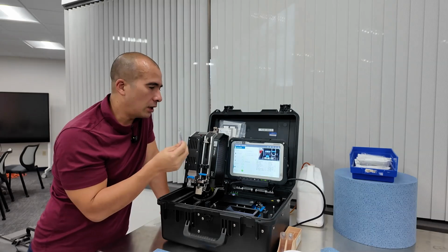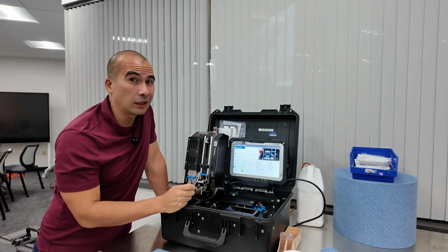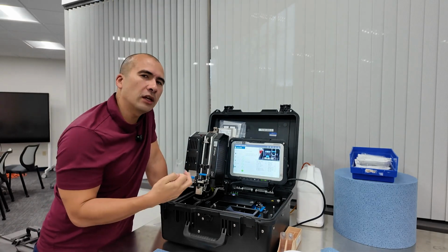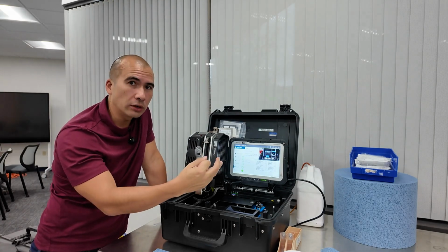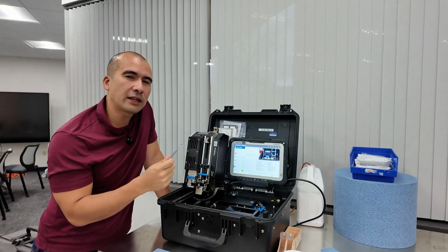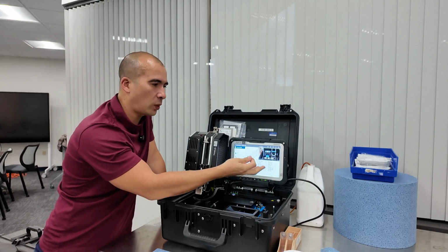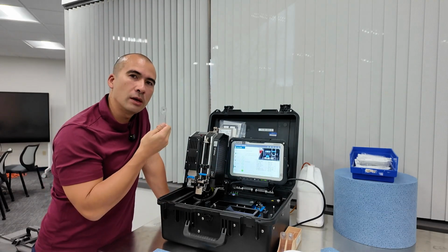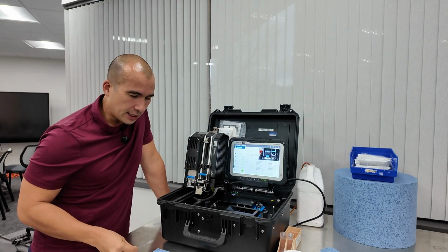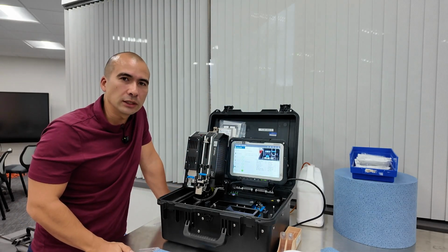Now, a couple of things to keep in mind, and where I think this is a pretty handy unit. Let's say, for example, I have a gas turbine, and I have wear that's occurring. A lot of the inline sensors will identify that wear is occurring, and that's hugely valuable information. But what I want to do is take that information and say, well, which part of the turbine is wearing out? And this is where the XRF analysis comes in useful, because the wear particles will be deposited on this. And then we can get an idea of, is it the white metal bearing, for example? That'll show up in a specific elemental signature.